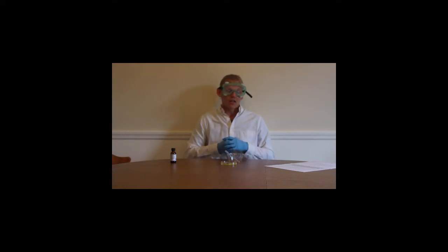This is my video on lab safety techniques. It's a really good demonstration to show students that there is a really big consequence if you don't use proper lab procedures, just like we saw with the acid in the eye.